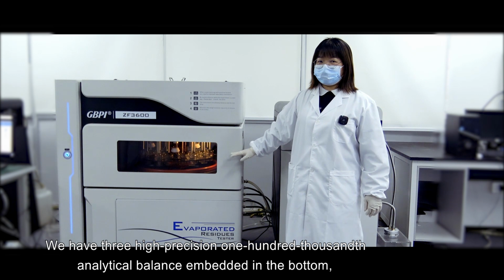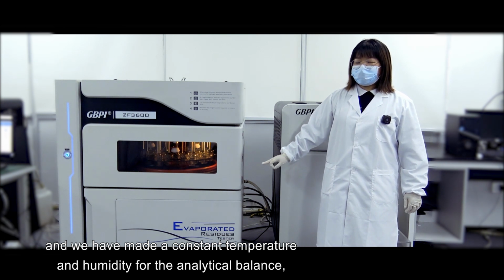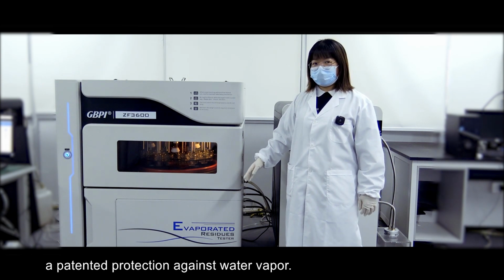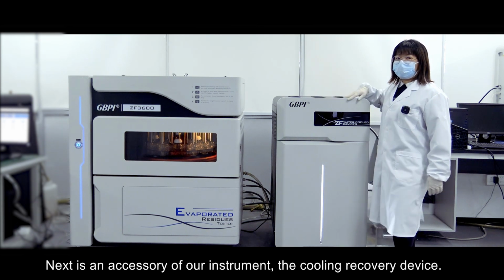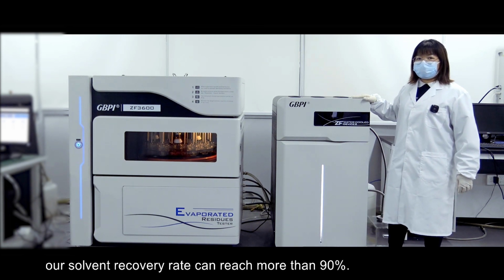Three high-precision 100,000th analytical balances are embedded at the bottom, and we have made a constant temperature and humidity chamber for the analytical balance, with a patented protection against water vapor. Next is an accessory of our instrument, the cooling recovery device. In our cooling and recovery unit, our solvent recovery rate can reach more than 90%.